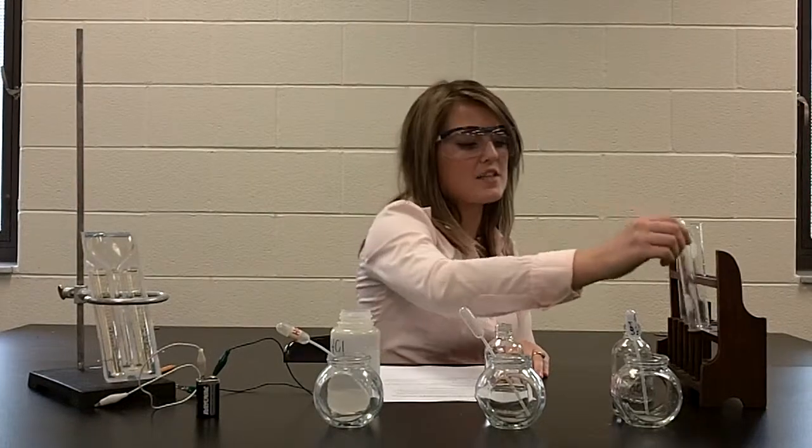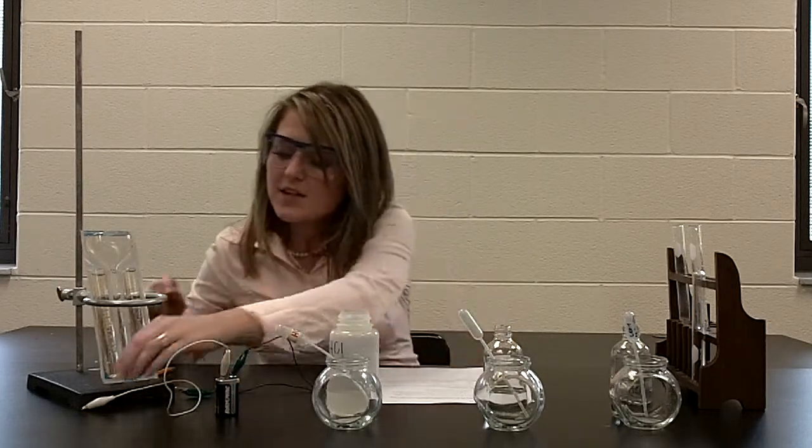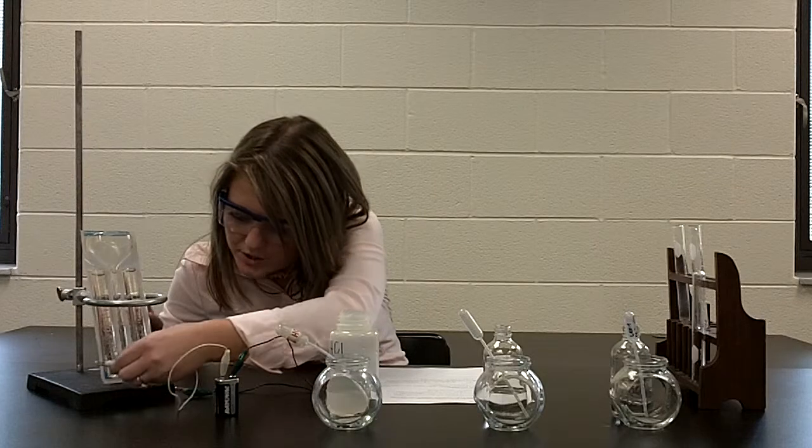This is just a reminder for those watching this lab that Part 4 immediately follows Part 3. So have your test tube ready to collect the gas in Part 4. Part 1 of this experiment does electrolysis of water. With the electrolysis, we have this little machine that is filled with a sodium saline solution. It's basically salt water. We have a 9-volt battery that we are connecting to the electrolysis machine.